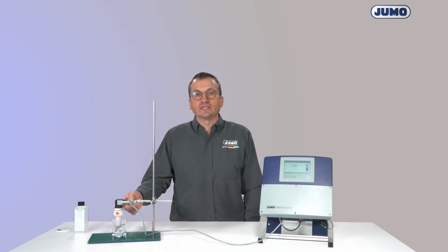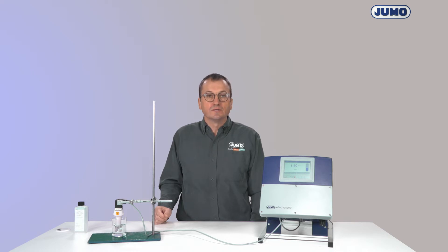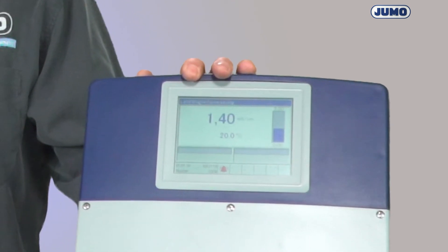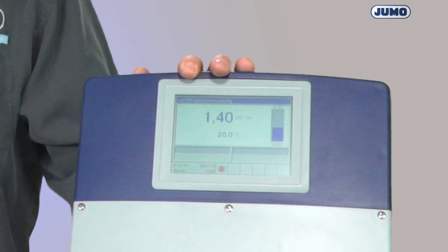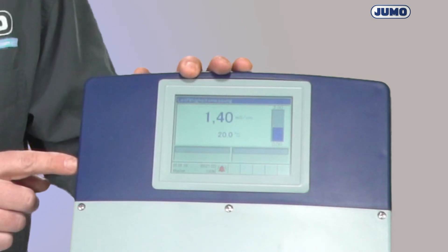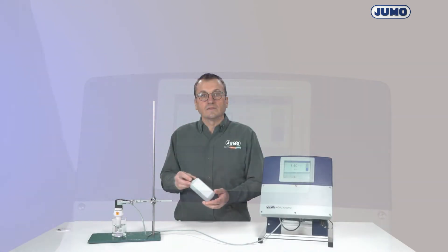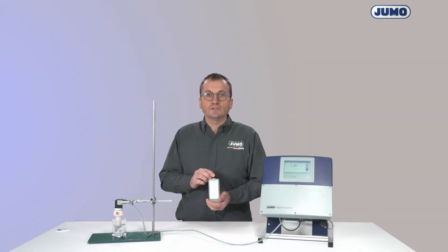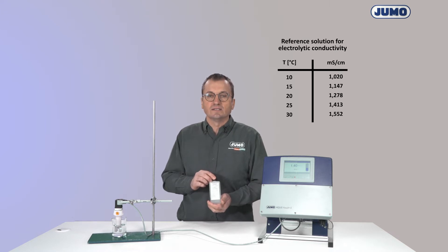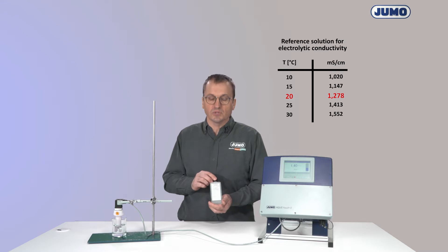The conductivity measuring cell has an RTD temperature probe whose temperature is also displayed on the transmitter. The display informs me about the temperature of the test solution. This is 20 centigrades. On the label of the solution, I can read the conductivity for 20 centigrades. This is 1.278 mS per centimeter.